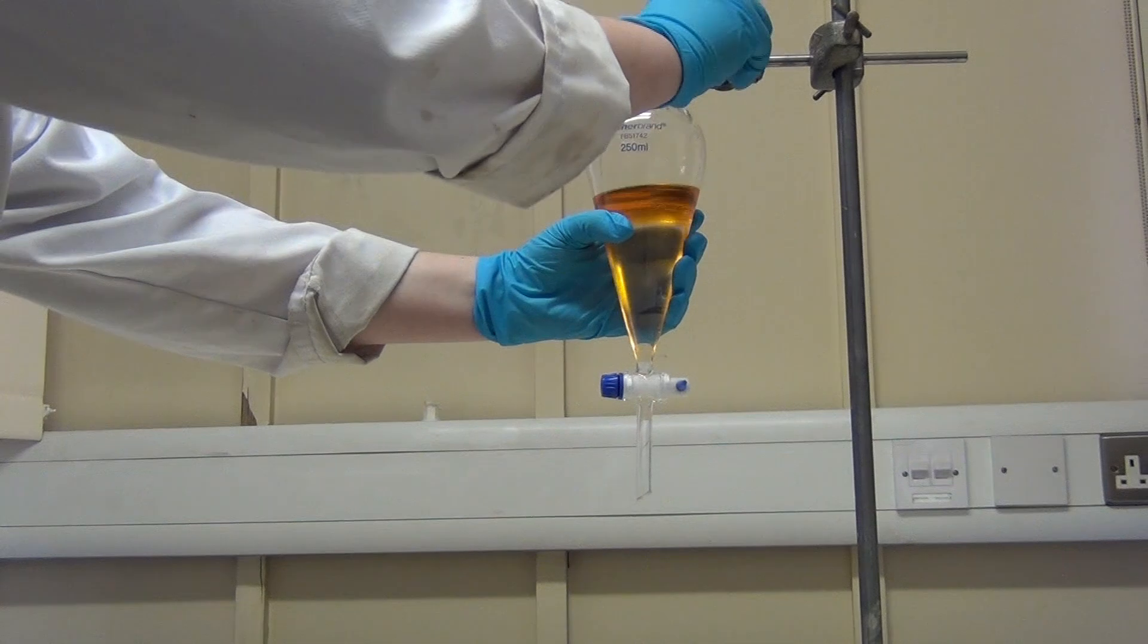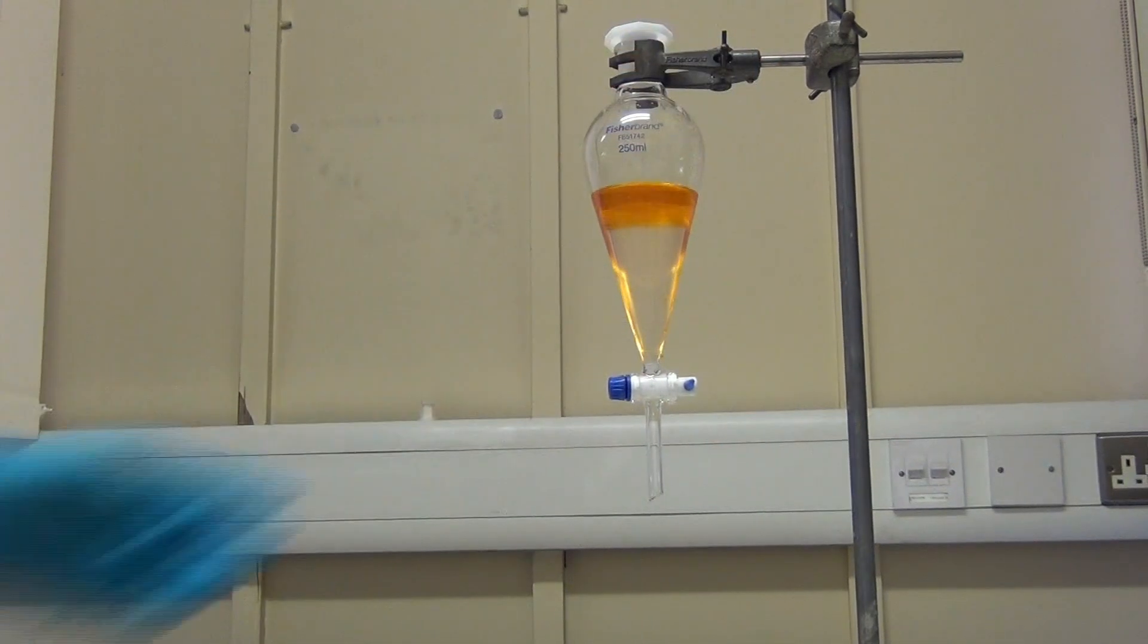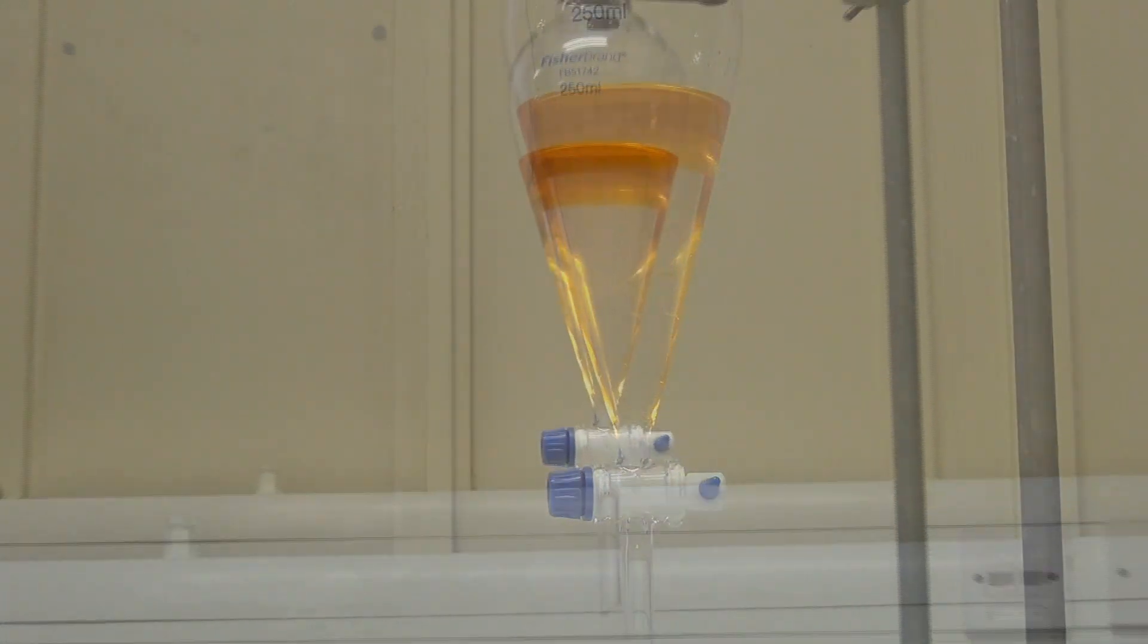This separation shows that the dye that we added has gone into the organic phase, which is why the bottom aqueous phase has lost its colour. Now it is time to extract the layers.